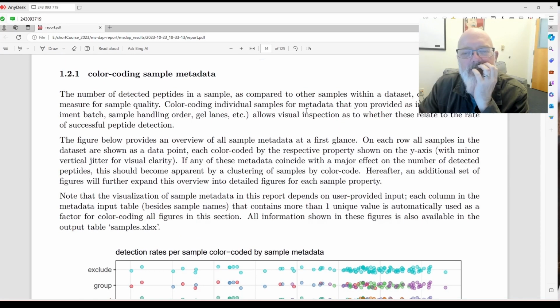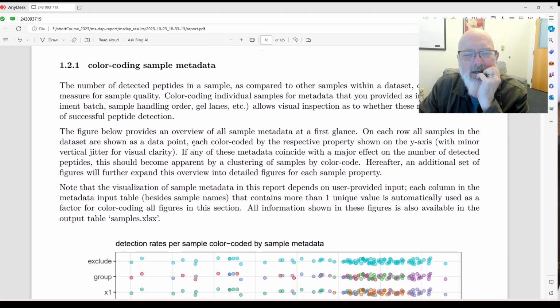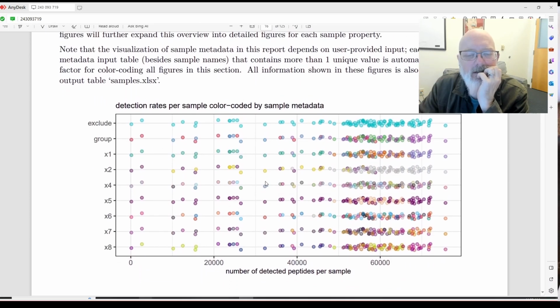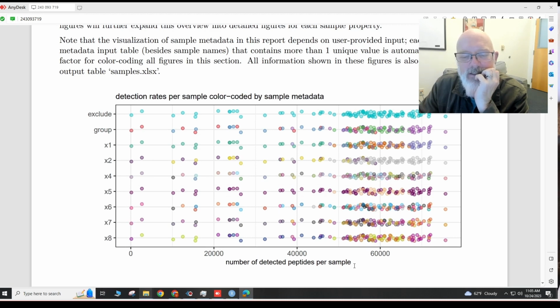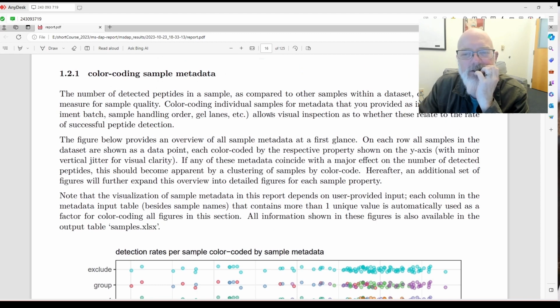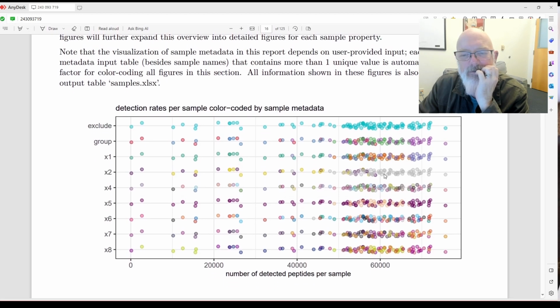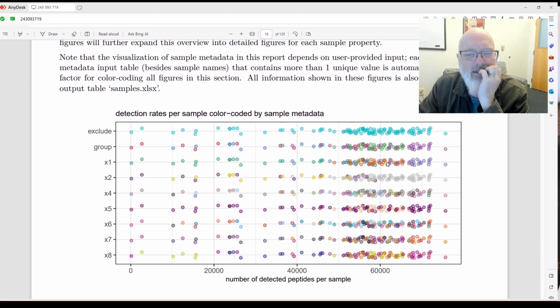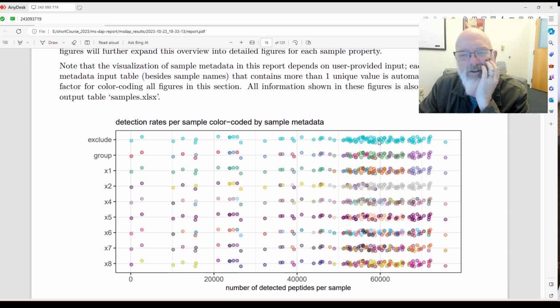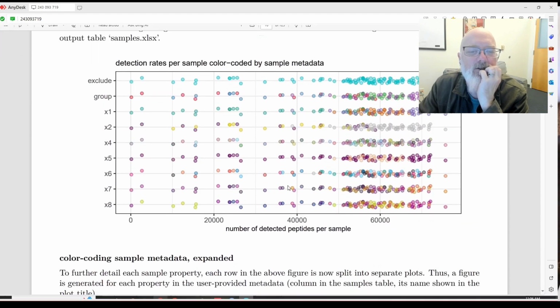Let's see. Color coding individual samples for metadata that you provide input for provides an overview. Each row is the different metadata, each color coded by its respective properties shown on the y-axis, with minor vertical jitter for clarity. Okay, I don't exactly know what that means, but that's the number of detected peptides per sample. And so, for example, in group, how are they color coded? Maybe they're colored by the different categories in each group, and they would be colored differently based on the different conditions in the different settings in the metadata. Oh, that's cool. That's probably exactly what it's doing, because you could see in exclude they're all set to false, so they're all the same color, but then we have the different metadata. Okay, that's kind of neat. So maybe you could set, like, exclude all of these or something.